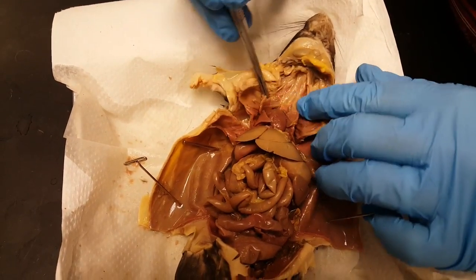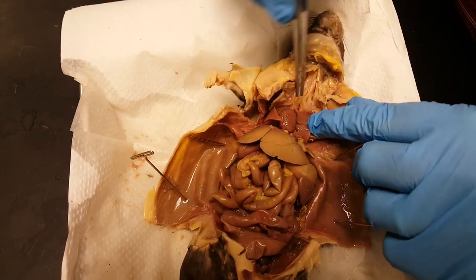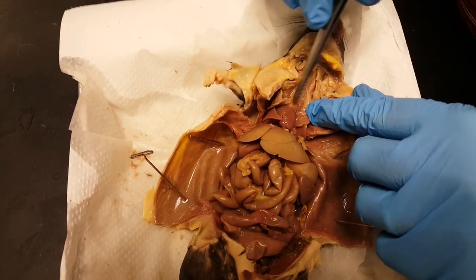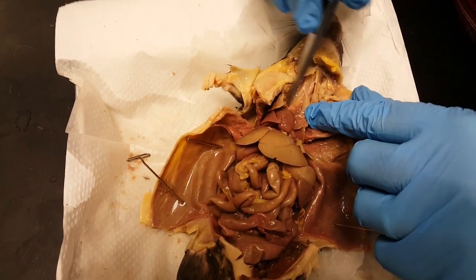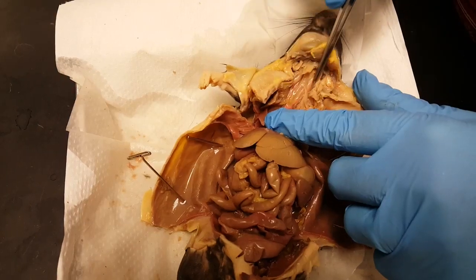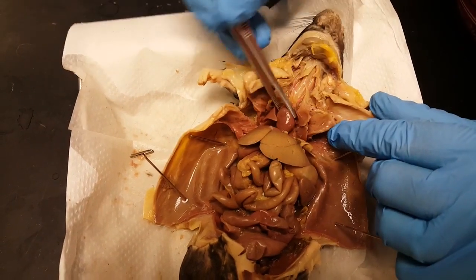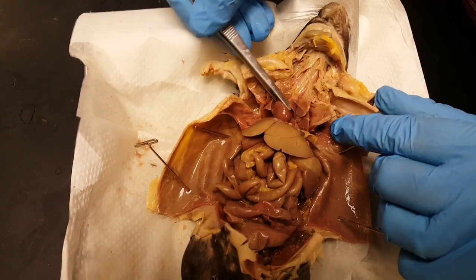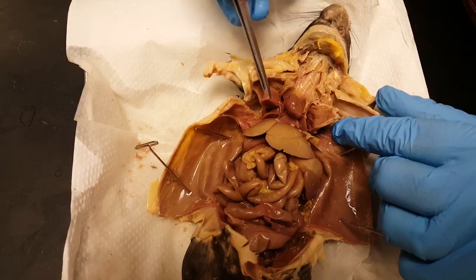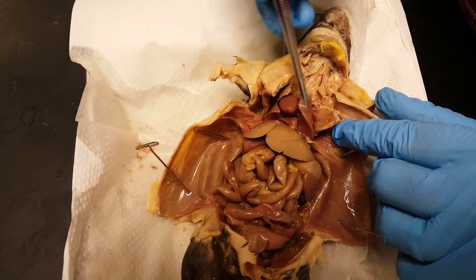If you follow that down, you get to the heart. You can see this rat's been injected. This is the aorta, and then you have the two carotid arteries that go up into the neck. There's your heart, and the two organs to each side are the lungs.